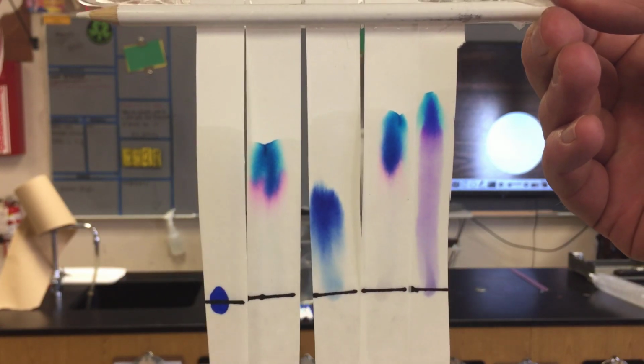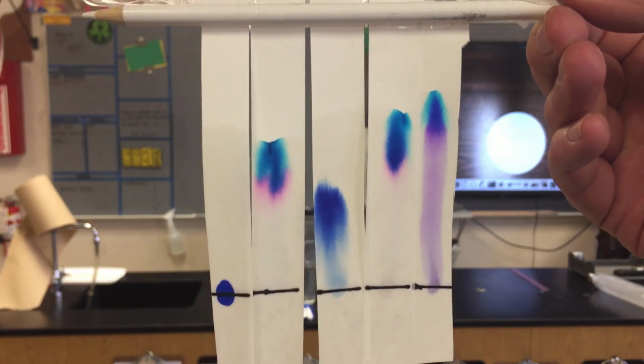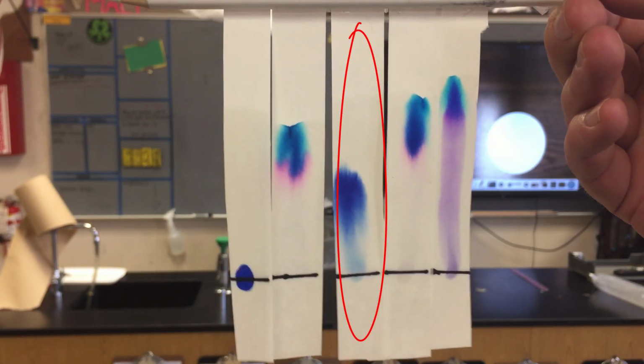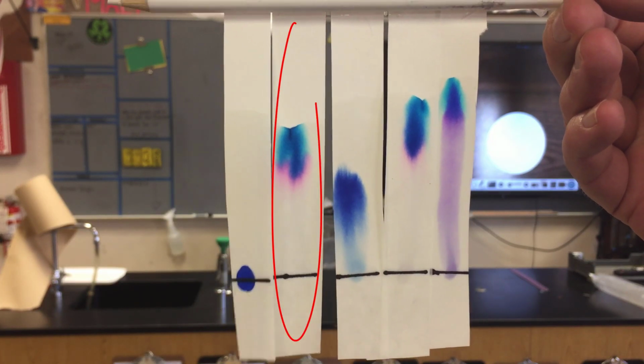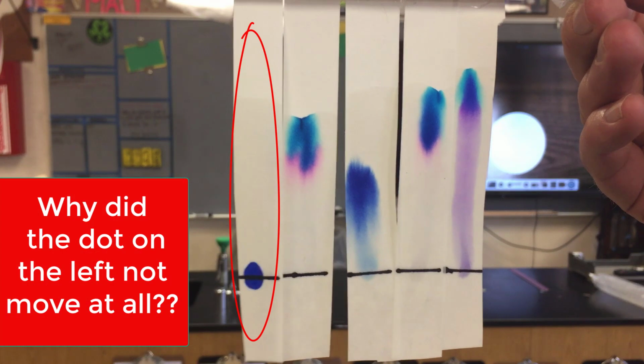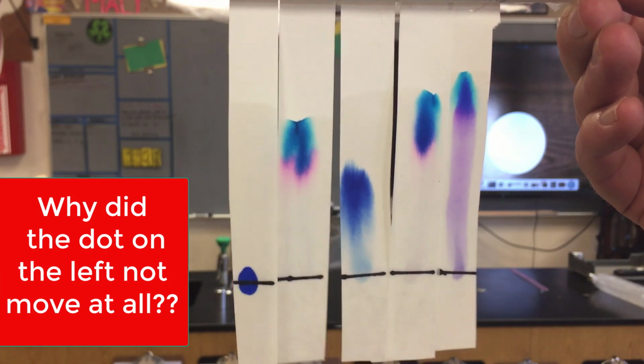This one has more of a showing of pink in there. The one in the middle looks like it's pure blue. The one next to that looks very, very similar to the second one from the right. And the one furthest on the left didn't move at all. Think about that. Why did that happen? Why didn't it move at all?